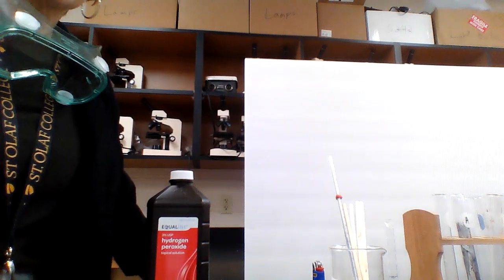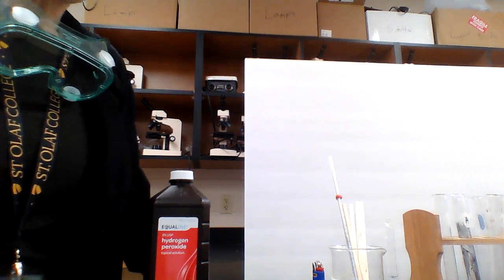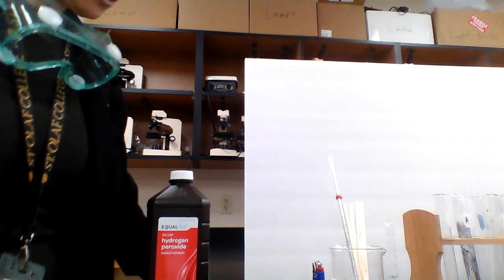So we're going to do a splint test. And for the splint test, you just need to say yes or no. Either it relit or it did not. And so a yes if it relit and a no if it did not relight. Okay, let's go ahead and start.